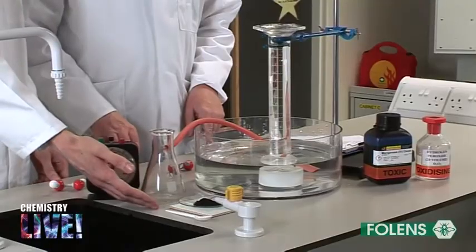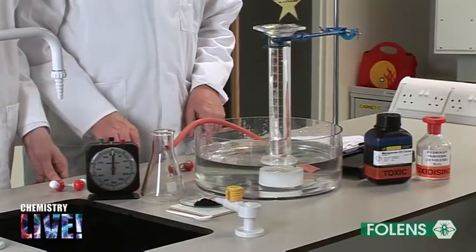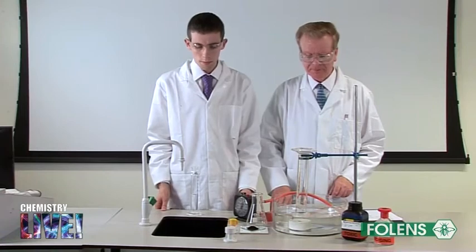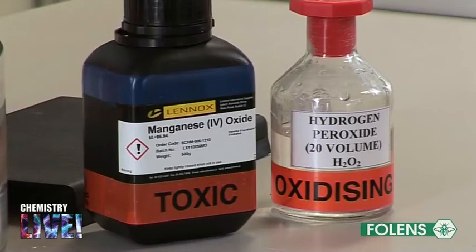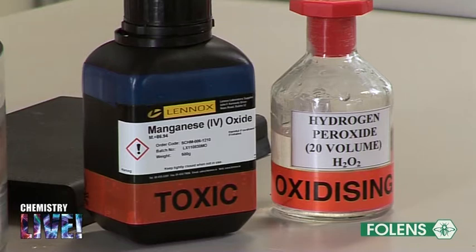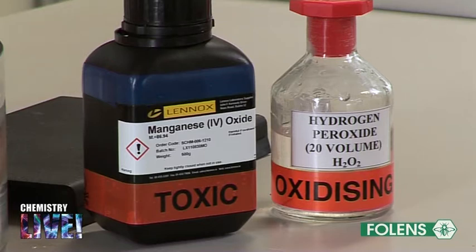Manganese dioxide is a black powder that is used in batteries. In this experiment we will use it as a catalyst to speed up the rate at which hydrogen peroxide decomposes to give off oxygen.